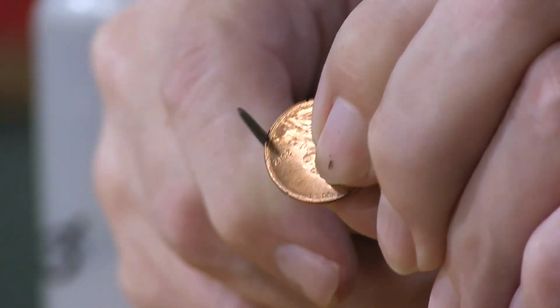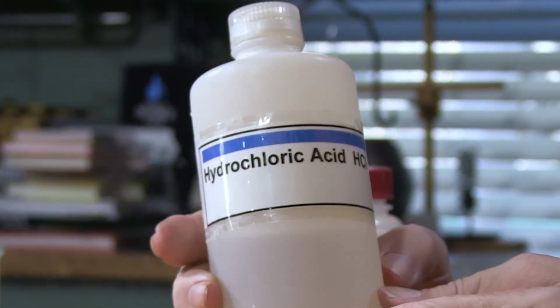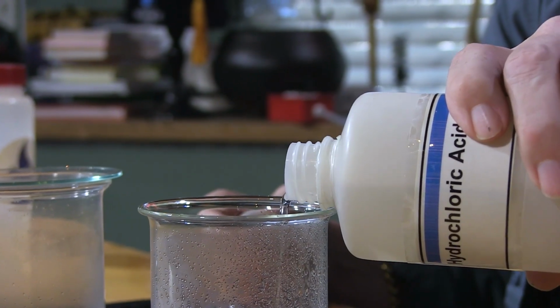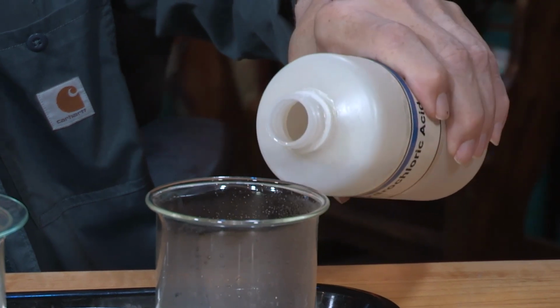I took this little file and cut a little notch in the edge of the coins and then put some hydrochloric acid. I said, Jake, where am I? I know where I can get a penny, but where can I get hydrochloric acid? I mean, come on. Pizza Hut doesn't deliver that anymore. If you go to the hardware store, paint store, you can get something called muriatic acid. It's not quite as strong as this, but it will still do the same thing. The muriatic acid's pretty mean. They use it to clean concrete before they paint it and stuff.